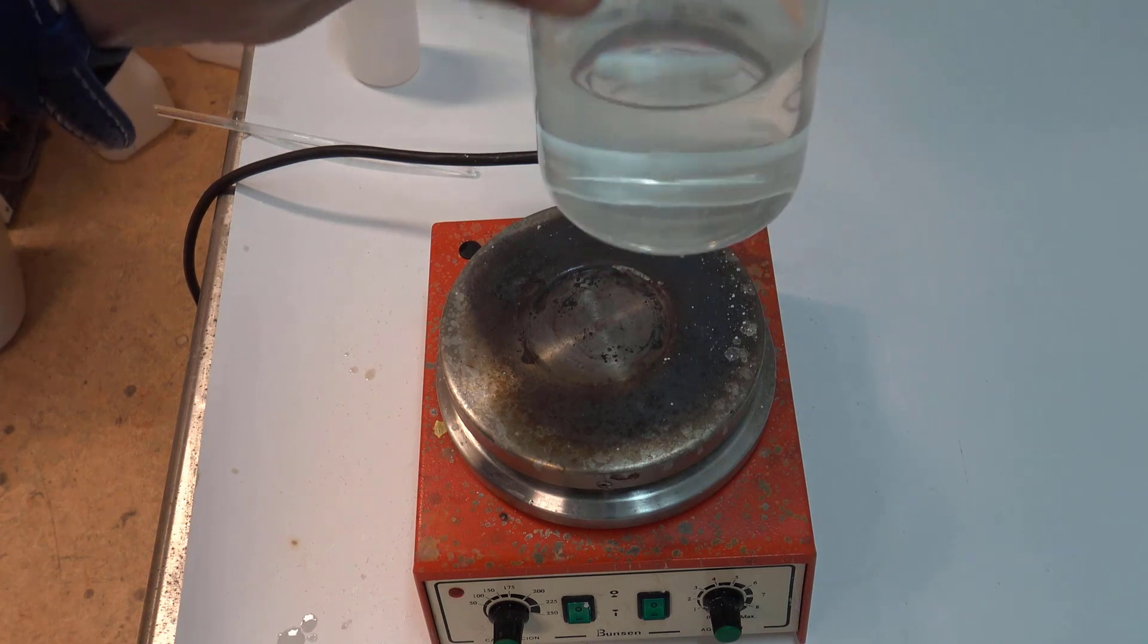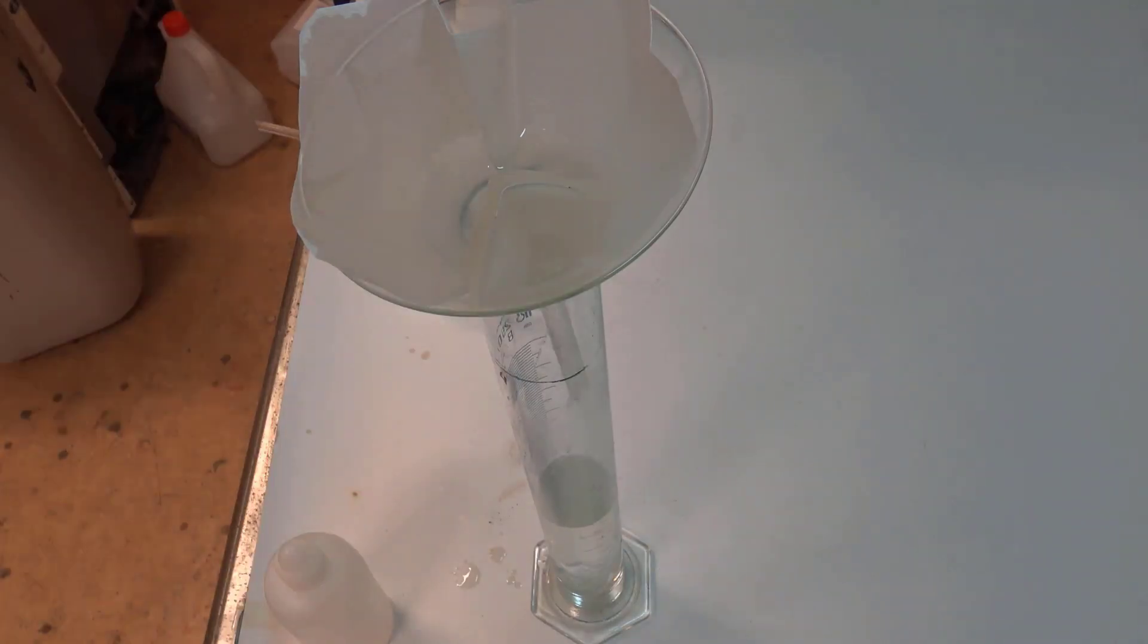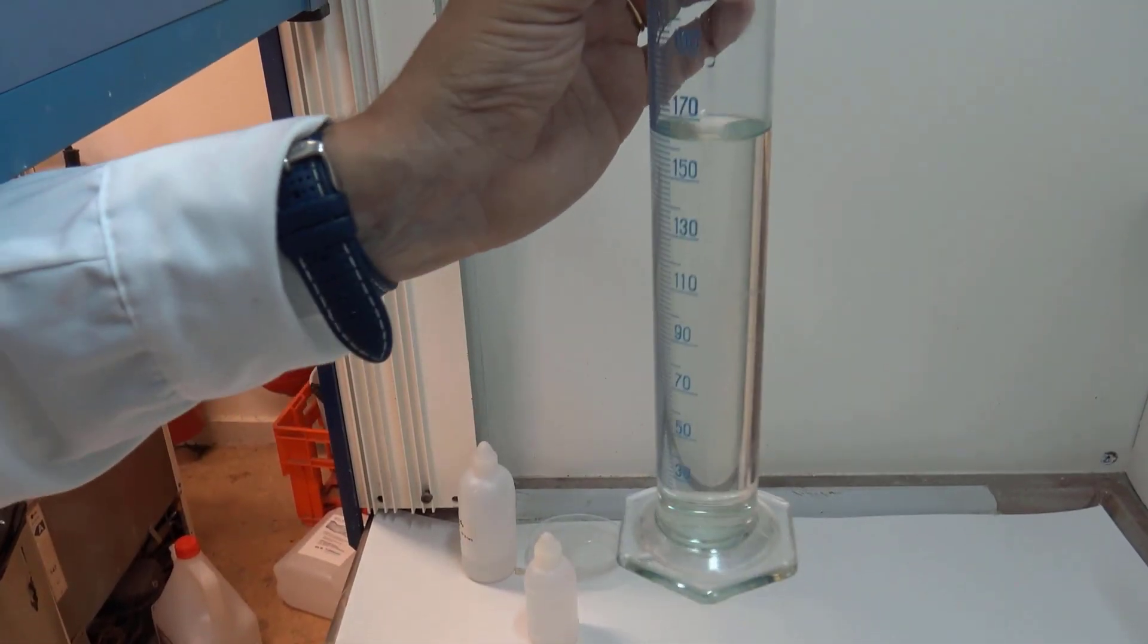After gel beads dissolved in the sodium hydroxide solution, I filtered the solution to obtain a more transparent aquarium later on. I consider this as a 2.5 times concentrated water glass solution.